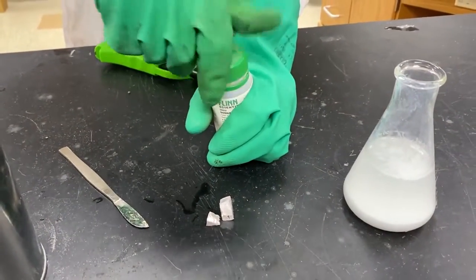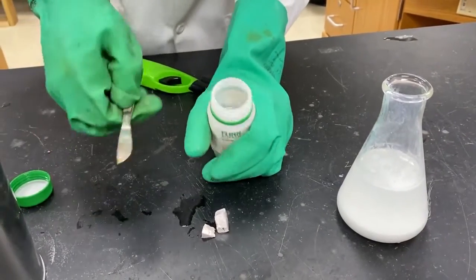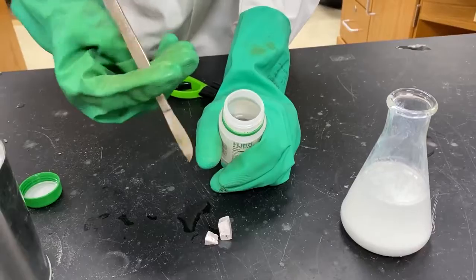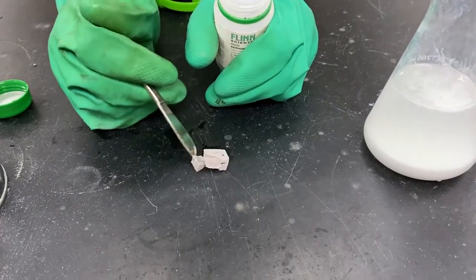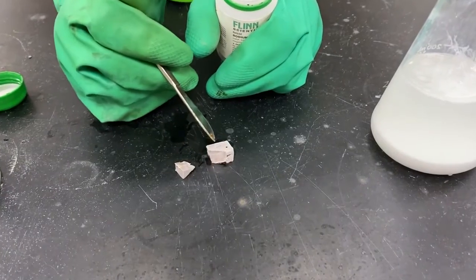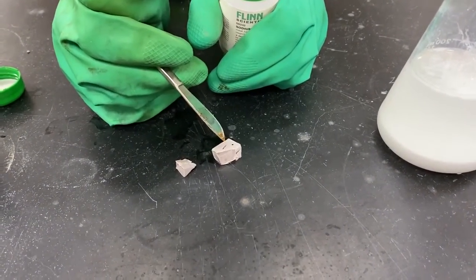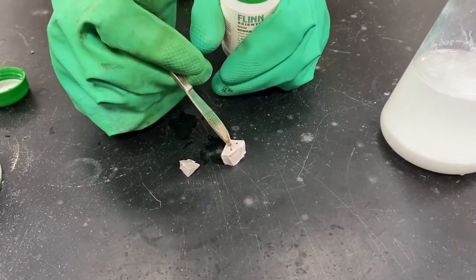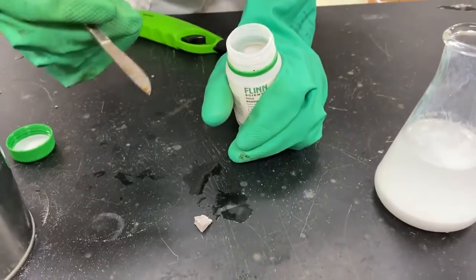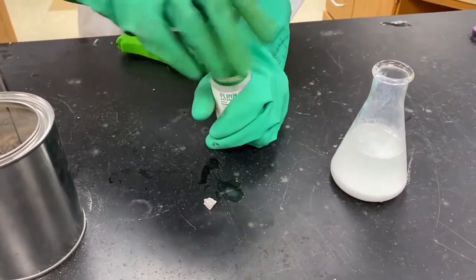So even though this sodium is stored in mineral oil, stored in kitty litter, it still oxidizes, and it's doing so now. If you look, it's already starting to become a little less shiny. And so you can see that even under these conditions, this is oxidizing. Pretty special. And so already you're starting to get excited. I am too, that this will be better than calcium.